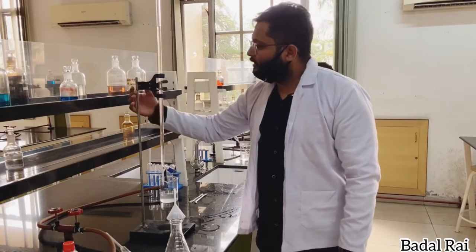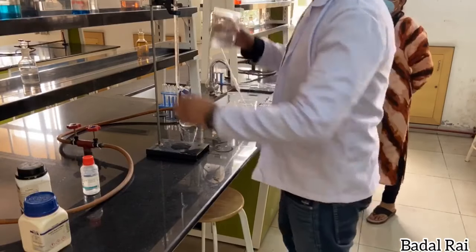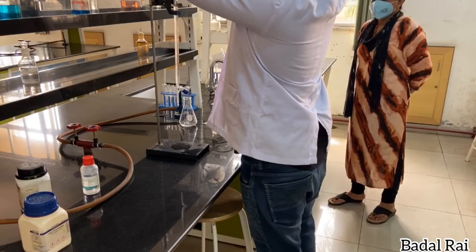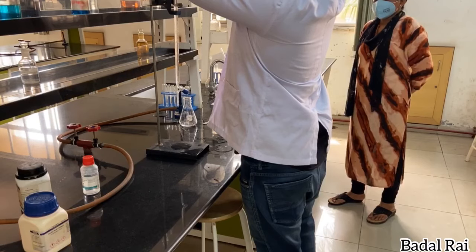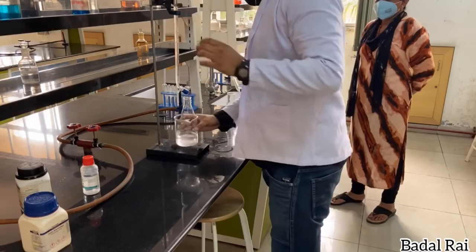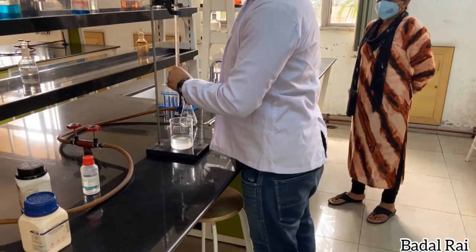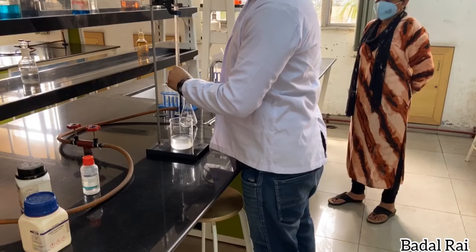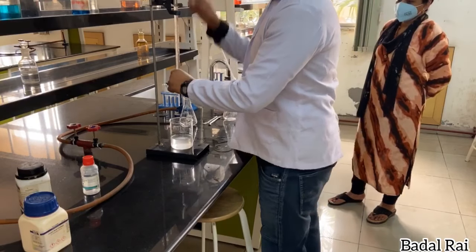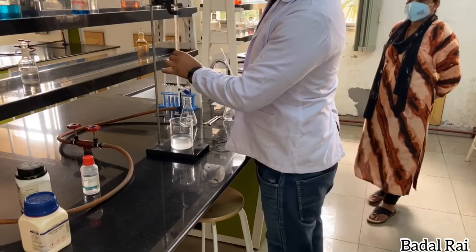This is the burette, and this is the burette stand. At the start of the experiment, we take oxalic acid — formula C₂O₄H₂ — and fill it into the burette using a funnel. We set the initial reading to 0.1, which we will treat as our zero point.